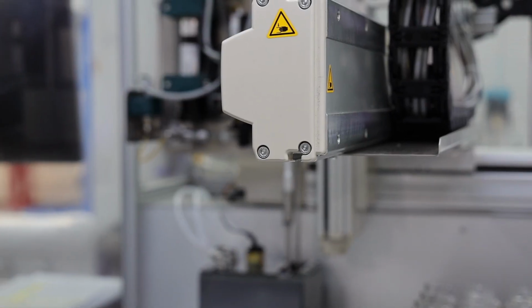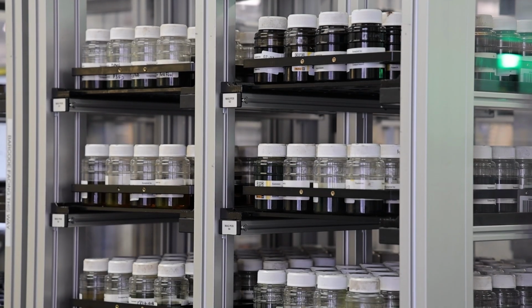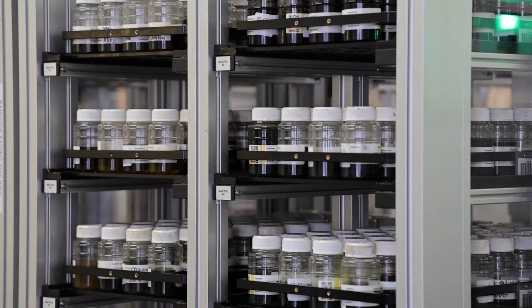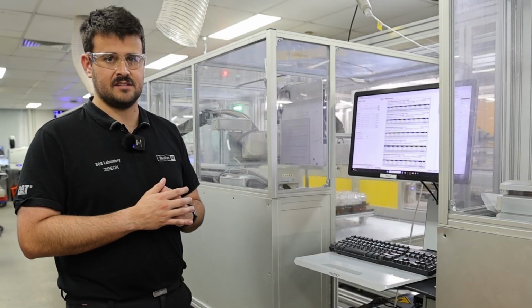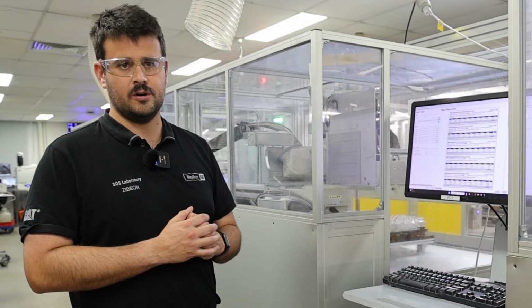What this system then does is it sees how much that laser bends or diffracts and how frequently it does that. And from there, it's able to give us both a count of how many particles are in your sample and at what size they are based on how much it interferes with that laser. Then at the end, we get a good snapshot of what particles are in your oil and at what size.